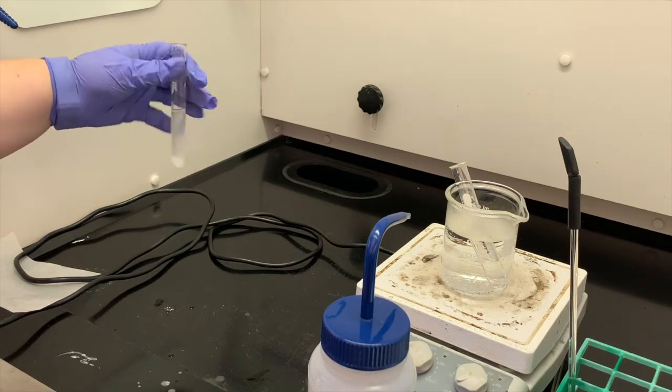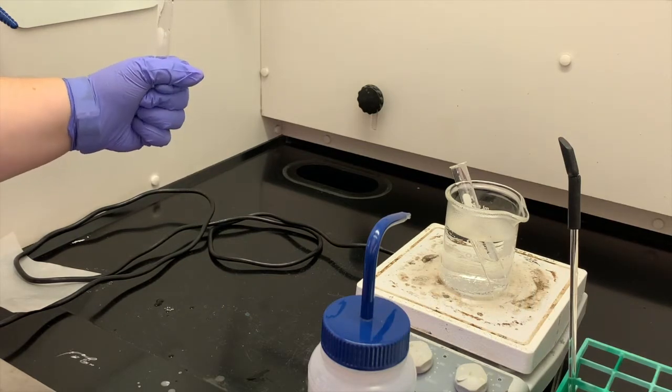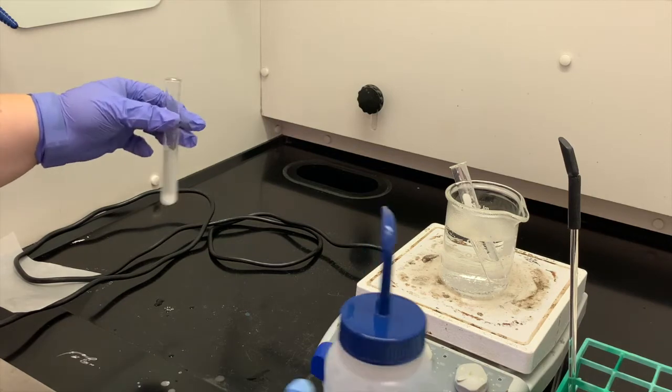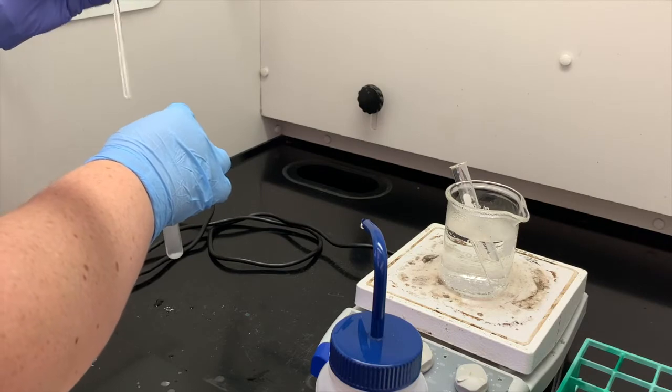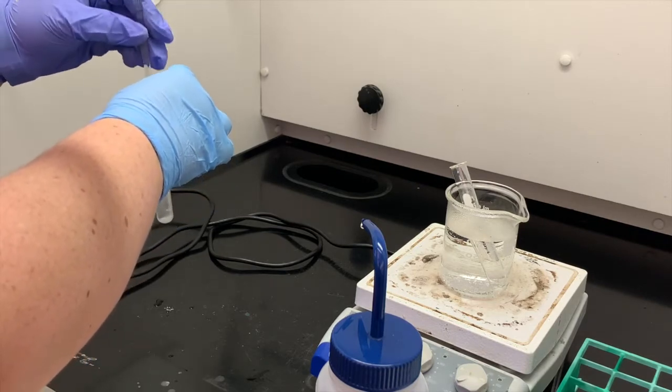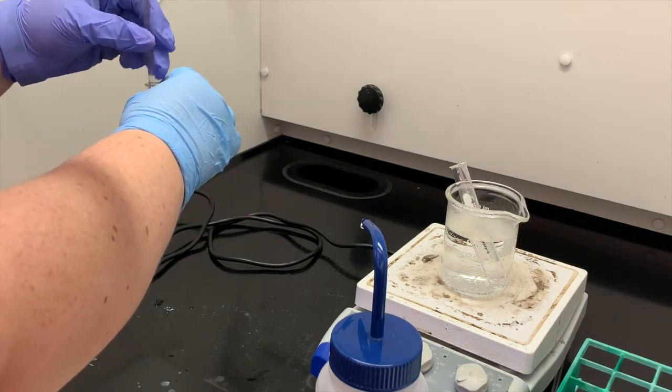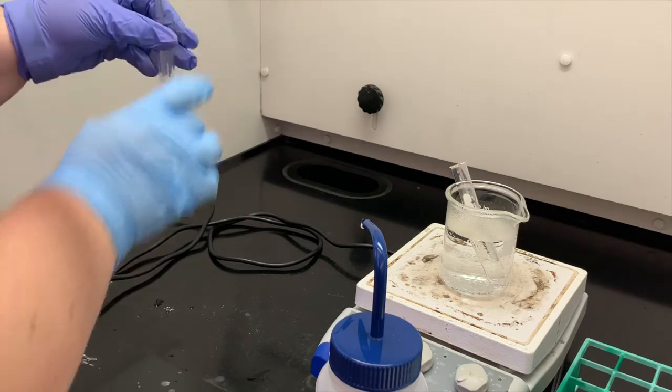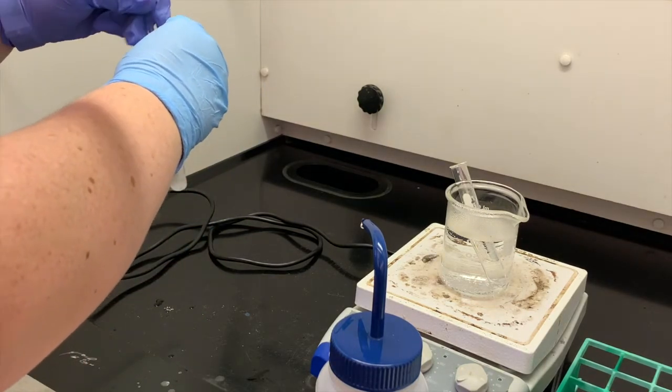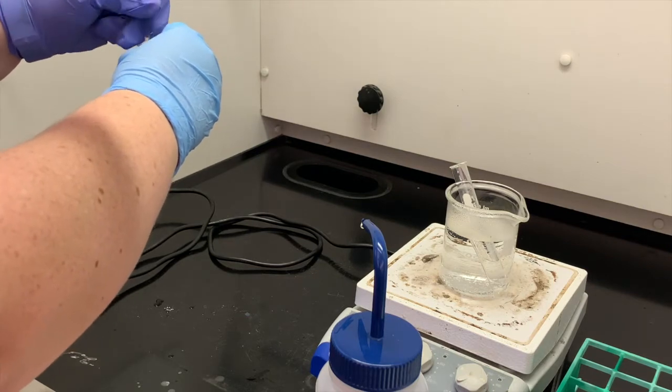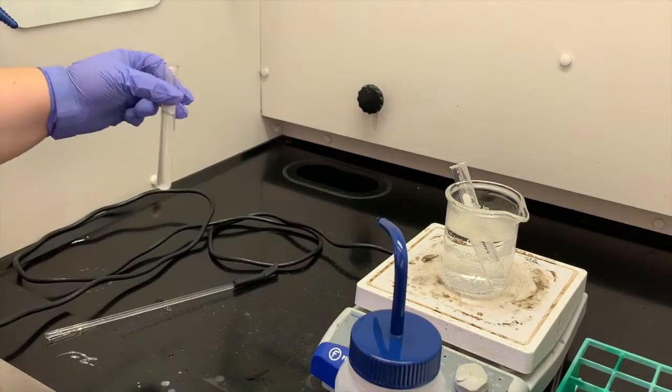If our reaction, if our test tube feels cold to the touch... in my small test tube I probably didn't need to add a whole gram, but they are dissolving in that water. And as they dissolve in that water, that test tube feels cold to the touch.